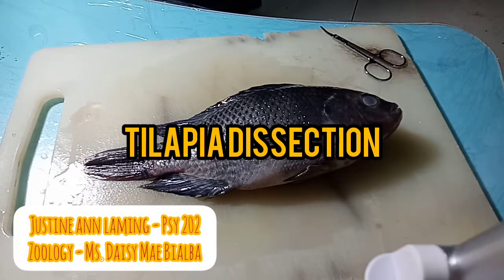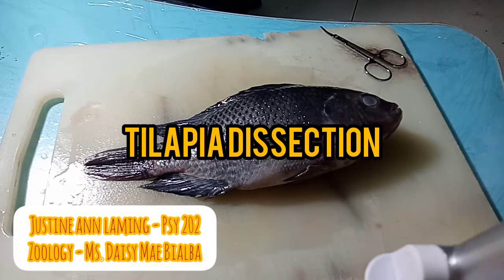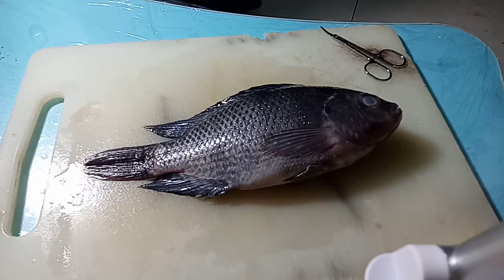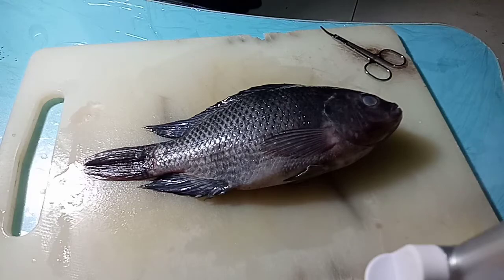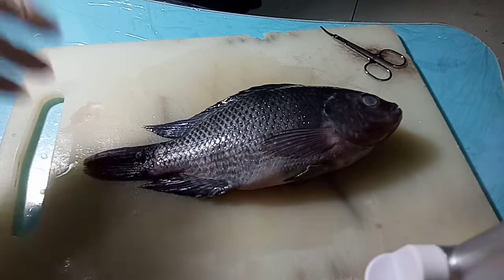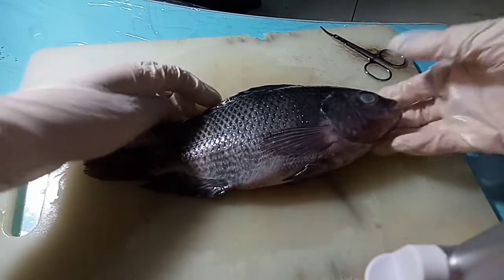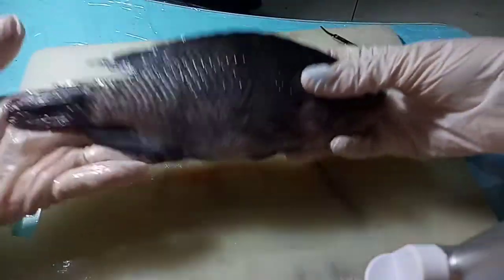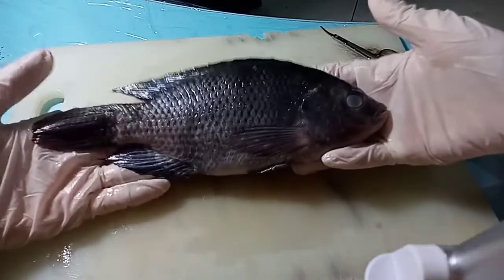Good day! So today, I will be dissecting a fish, specifically a tilapia. First, let me discuss the external regions of the tilapia.